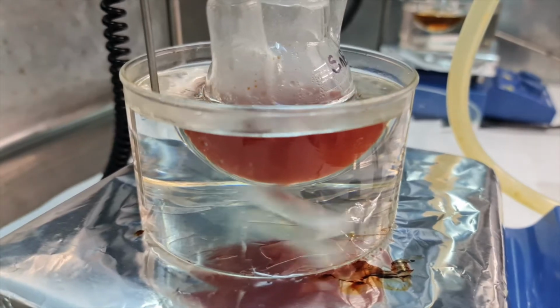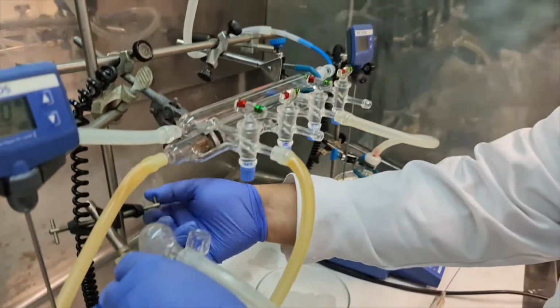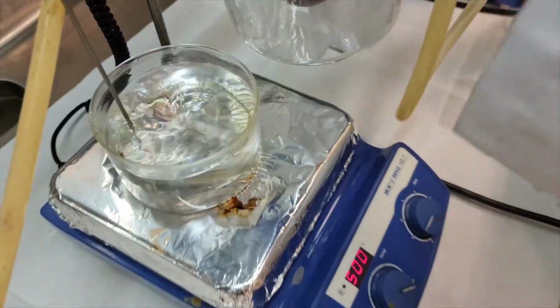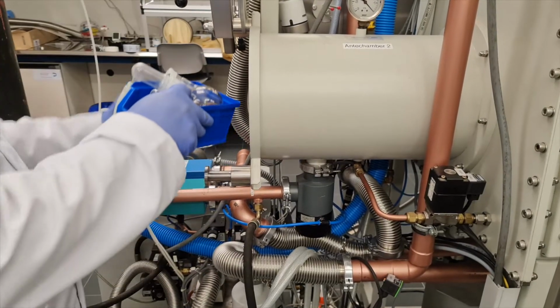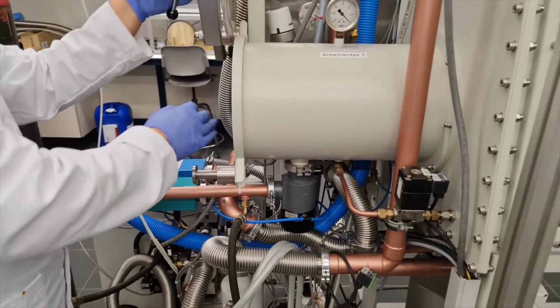After 25 seconds, the resulting crude solution was cooled down to room temperature in an ice bath to stop the nanocrystals' growth. Finally, the reaction vessel was put inside the glove box for purification and storage for future use.